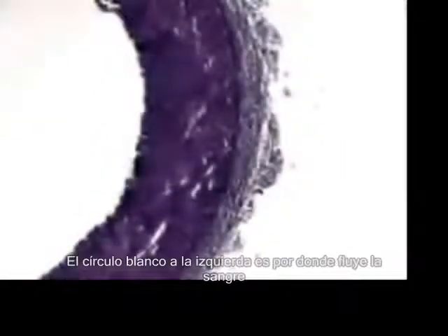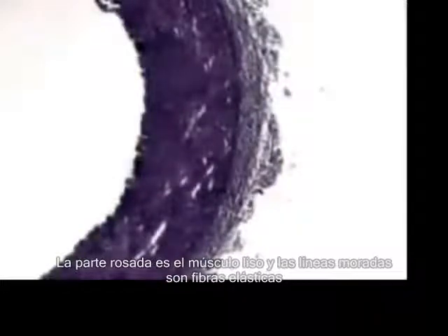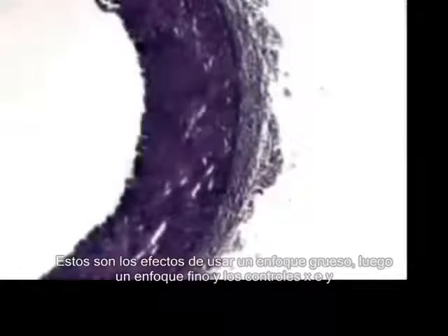What you see here is the cross-section of the human artery. The empty center is where the blood would flow. The pink section is the smooth muscle, and the purple strands are elastin. These are the effects of using the coarse focus, fine focus, and XY controls.